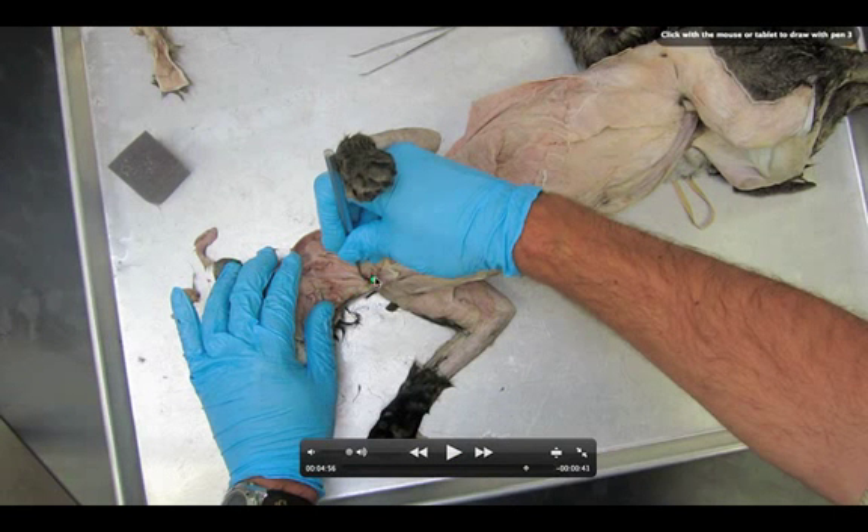What we're looking for is a muscle that's attached to the sternum and is going to go all the way up and attach to the mastoid process on the temporal bone. This muscle is called the sternomastoid. There's another muscle that goes from the sternum up to the hyoid bone — it's called the sternohyoid. So sternomastoid and sternohyoid — two different bones, two different muscles we're going to be looking for here.